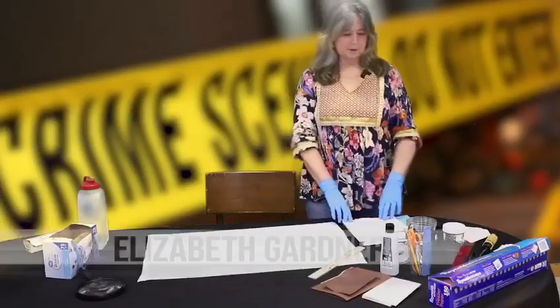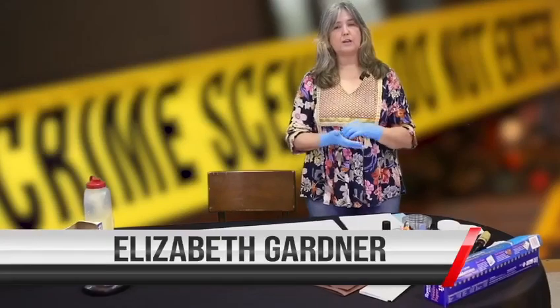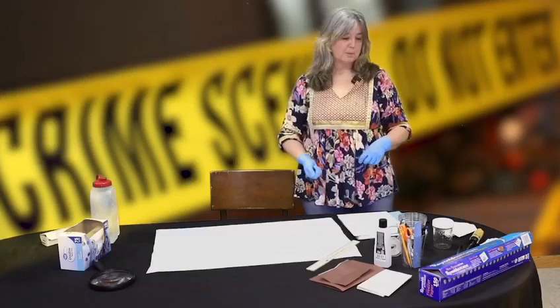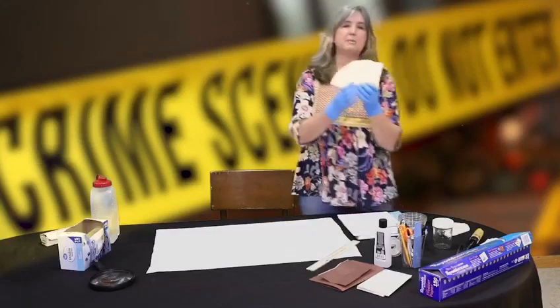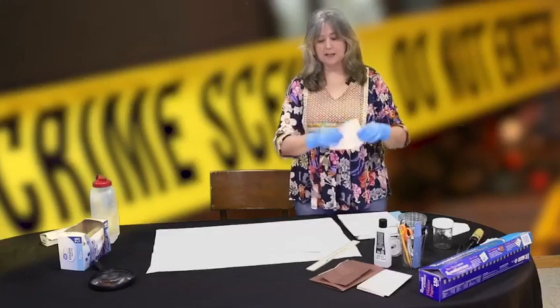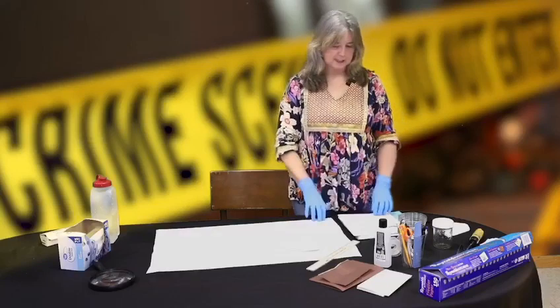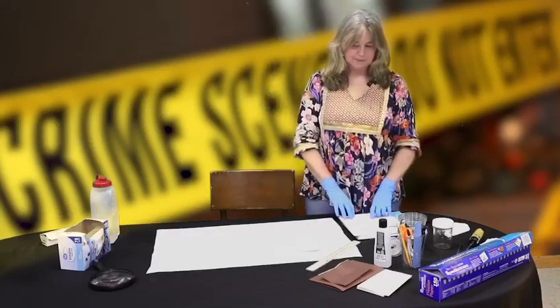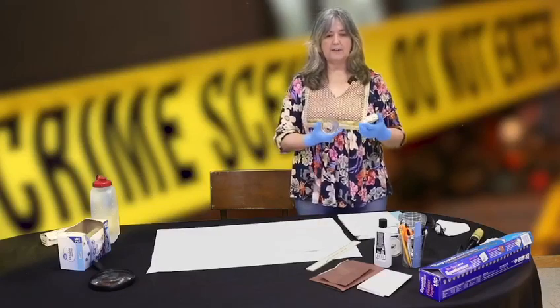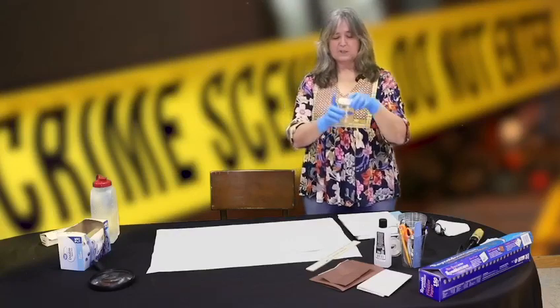So this exercise is paper chromatography. We're going to look at inks and pens and how we can tell the difference between a document written with a Bic versus one written with a Parker pen. For this, the best thing to have is some coffee filters. These flat cone ones are nice because they're already flat, but you can use the cup-shape coffee filters — you'll just need to flatten them out. This is our chromatographic paper. We also need a chromatographic chamber — you can use any glass jar, like an empty jelly or pickle jar. This little canning jar is about the right size. You want a clear glass so you can see through it and keep track of what's happening.